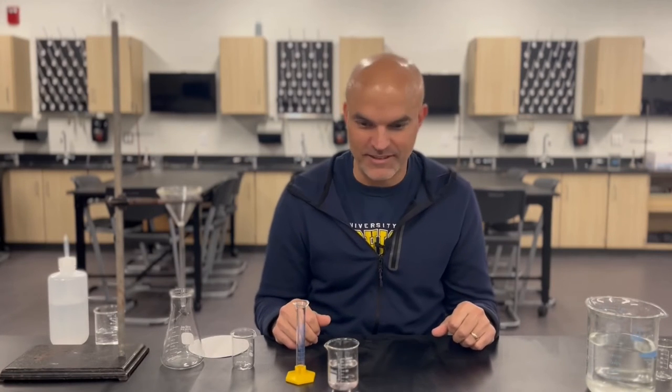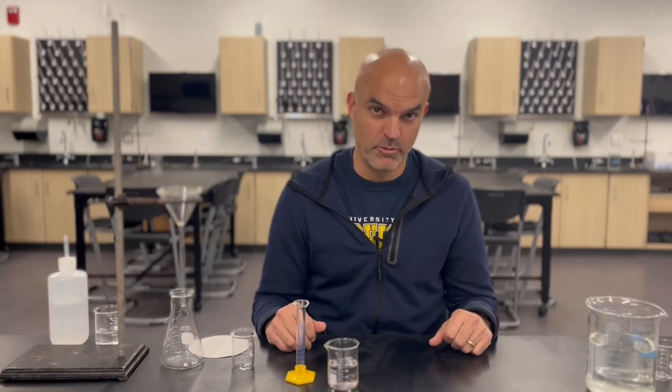Today we're going to learn about a lab technique known as gravimetric analysis. When you hear the term gravimetric analysis, it sounds kind of scary — like what am I getting into? But actually it's not that challenging. Pay attention, and by the end of this video I think you'll understand what gravimetric analysis is all about and be able to use it to solve problems in chemistry.